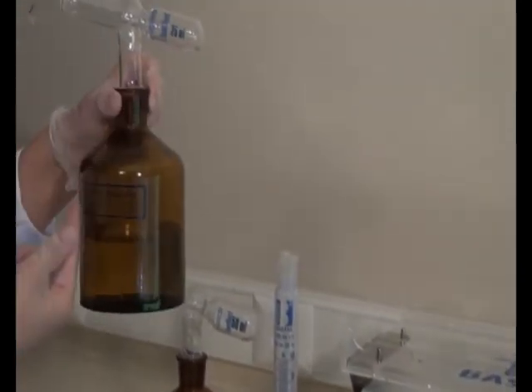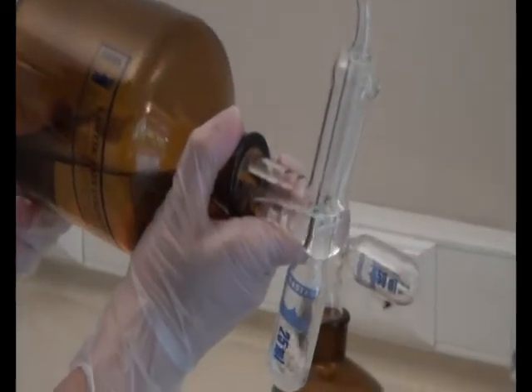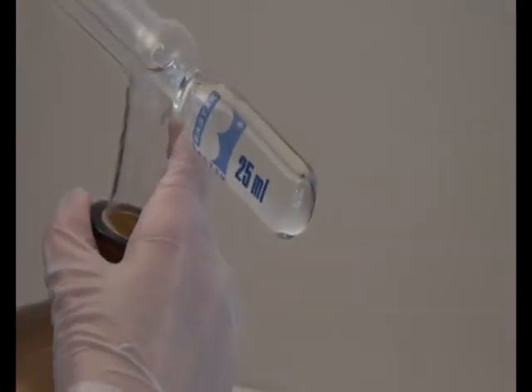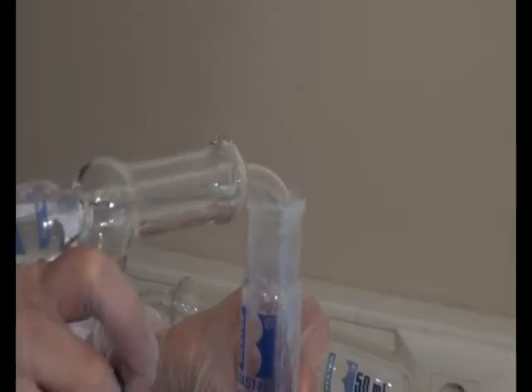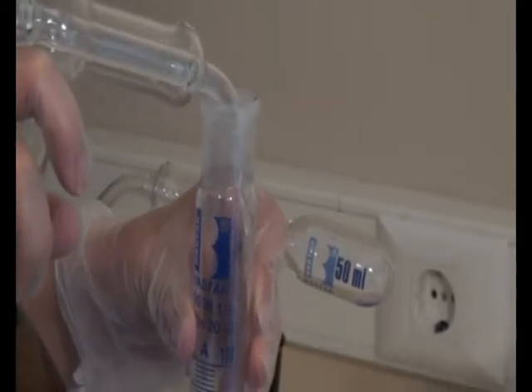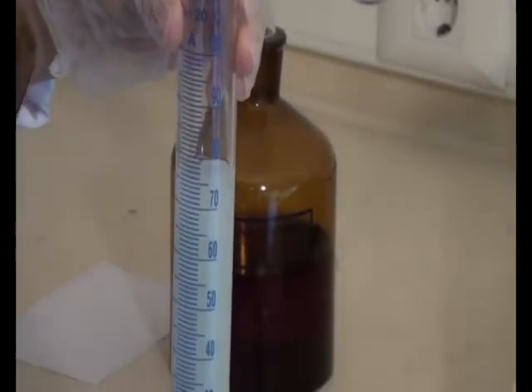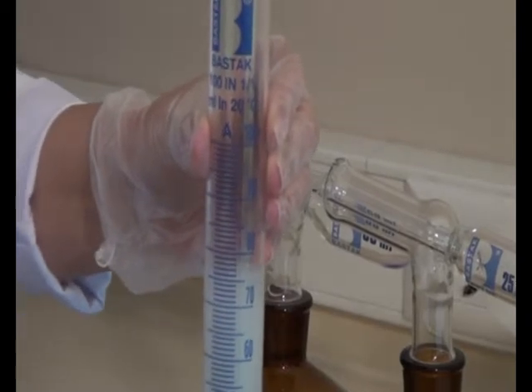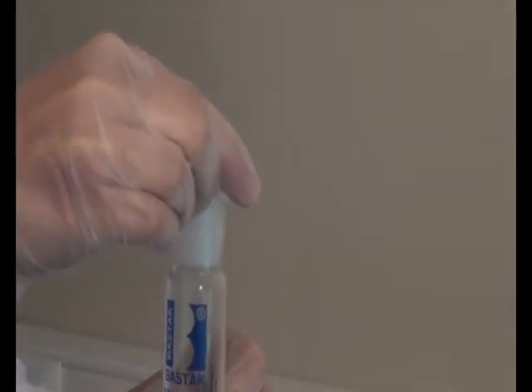A 25 ml lactic acid solution is added into the mixed solution and the cover closed back. The tube is then shaken 3 to 4 times.